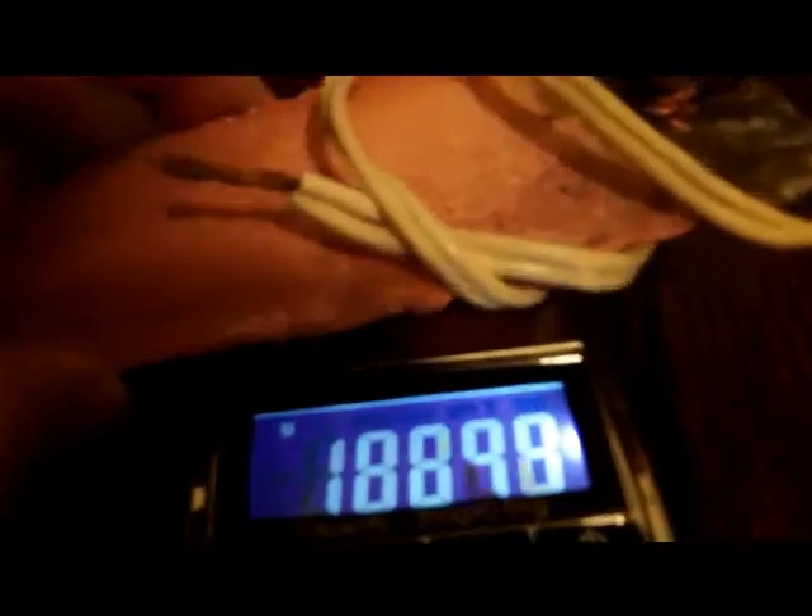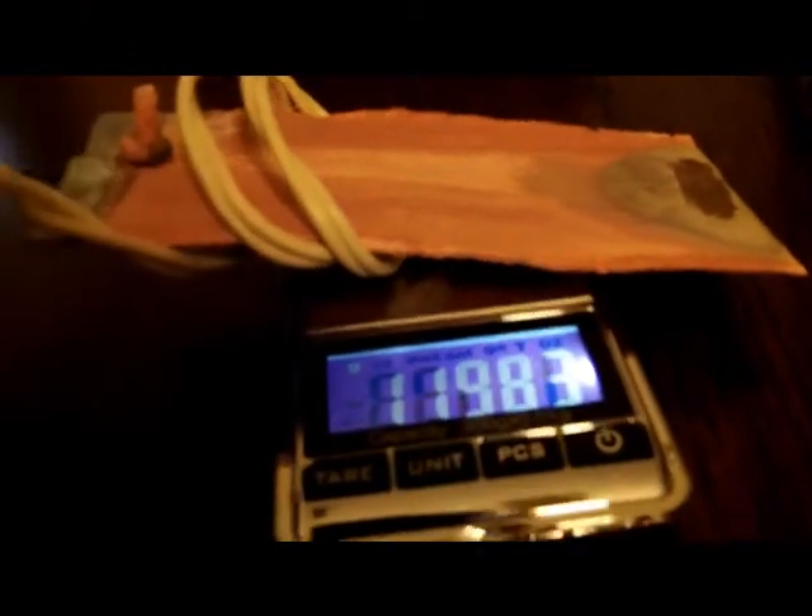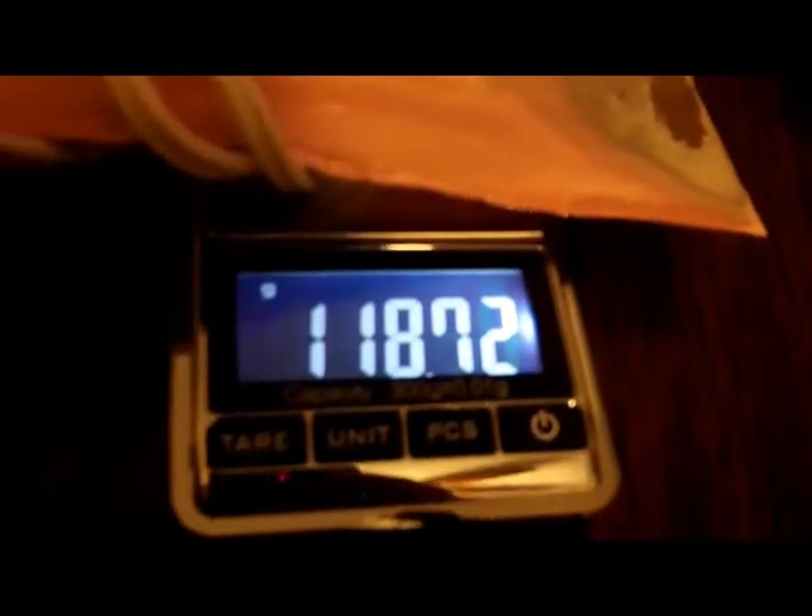After 60 hours total approximately, we are at 118.72 grams. Some observations about electroplating: looking at the edge, we get a lot of copper along the edge that will flake off — it's spiky, not attached as a smooth sheet. At the bottom of the back side we get intermittent layers of some sort of other metal, which is not plated on very firmly — rubbed off with the paper napkin, there's some kind of coppery bronze underneath.